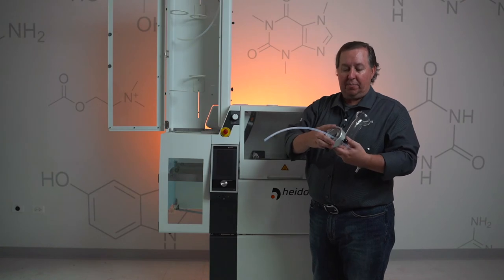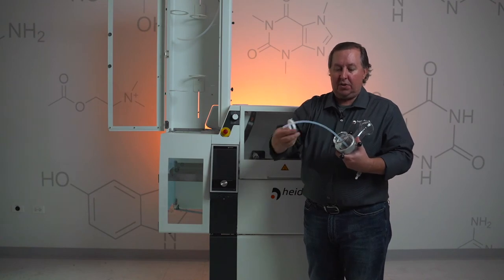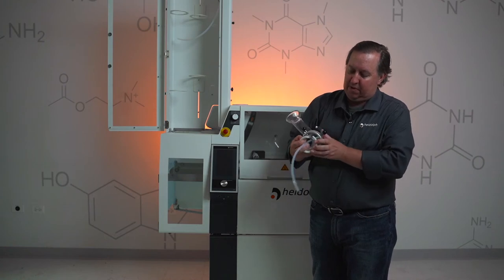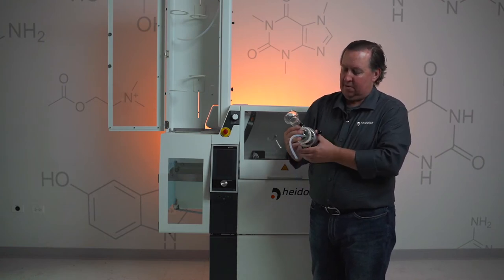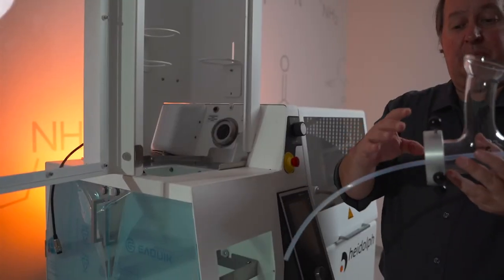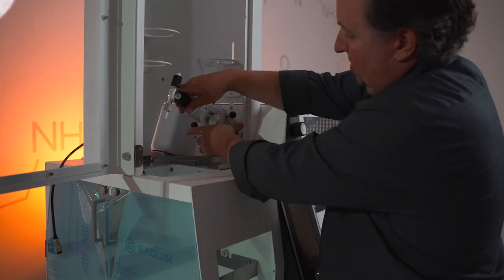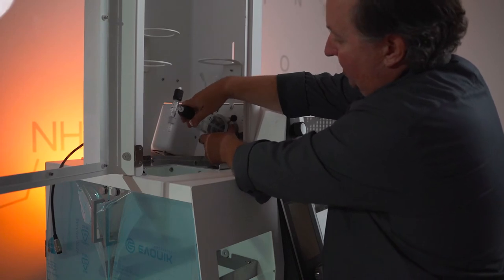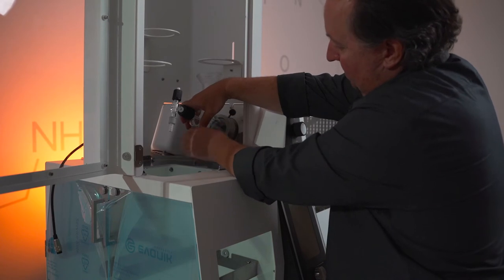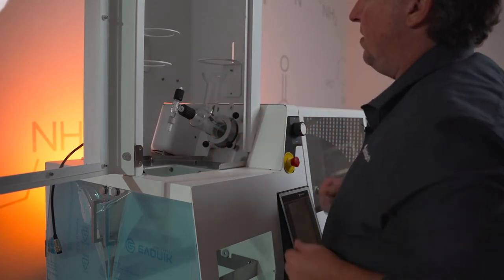Slide your metal piece on first. Take your split ring — the thinner side is going to be going towards the threading. Open it up, slide it over the top, and you're in place. Once you have your coupling in place, you want your feed tube to slide in through the vapor tube. Press your A distributor up against that sandwich seal and start getting your coupling caught. Get it in there nice and tight and just give it a little bit of a turn to snug it down.